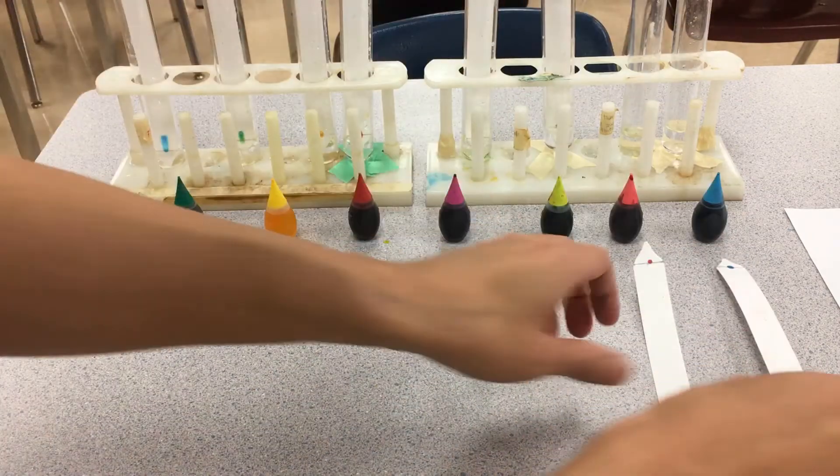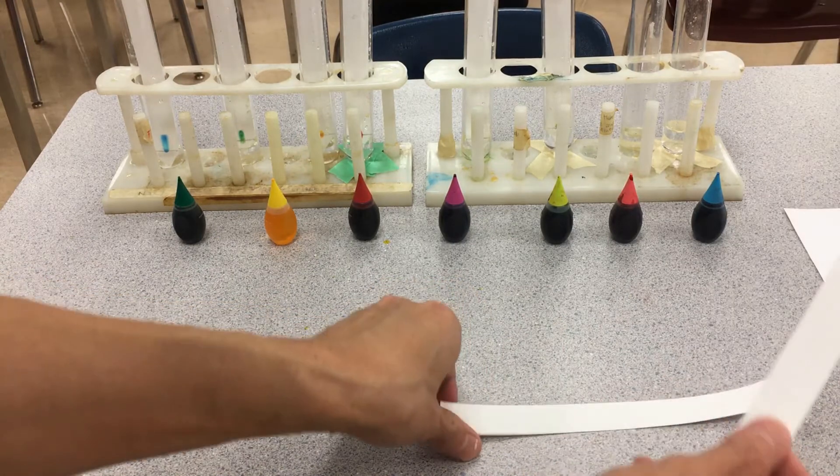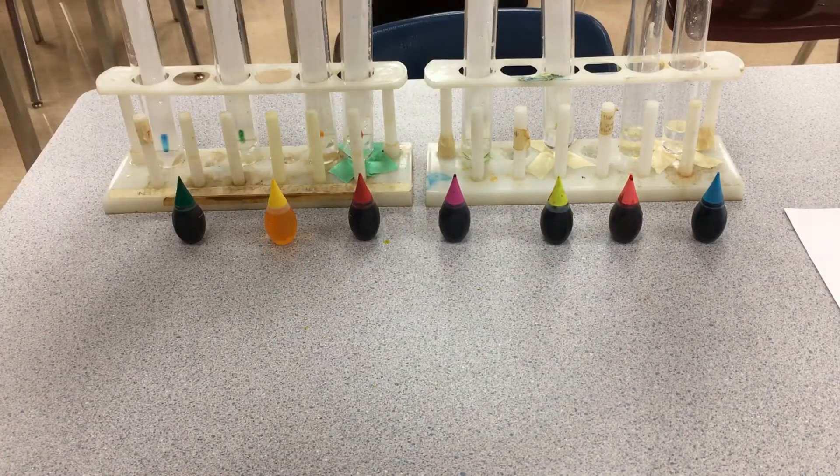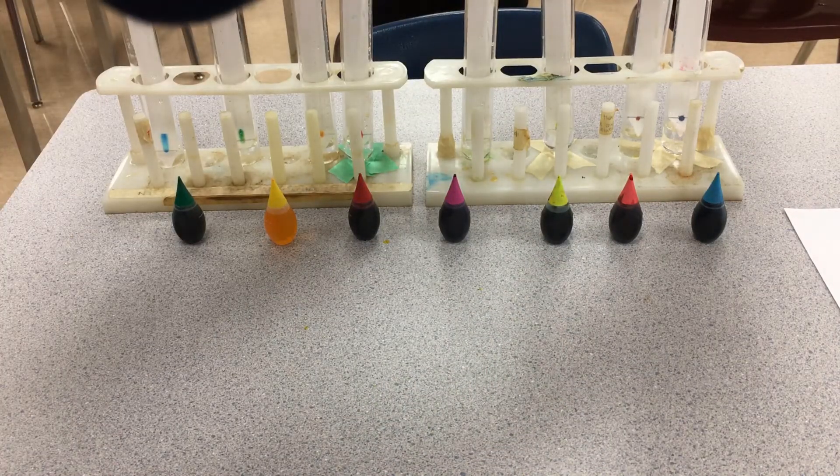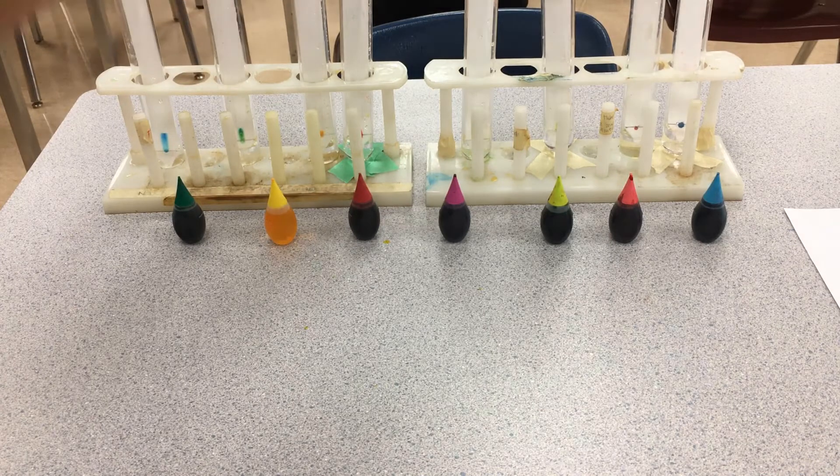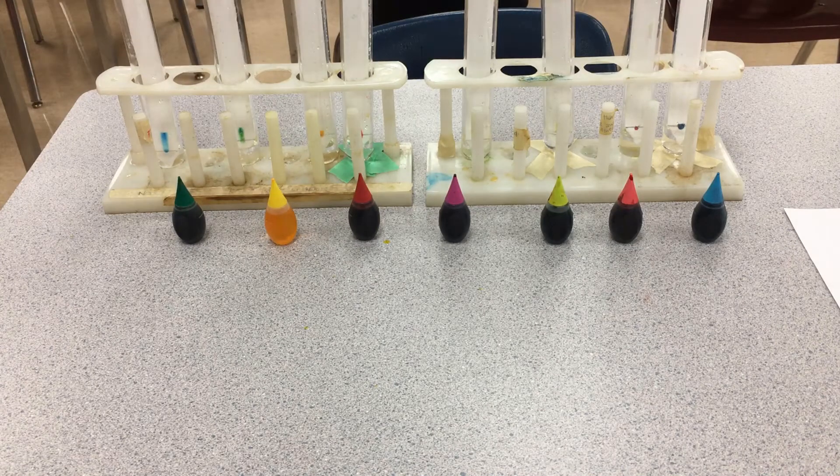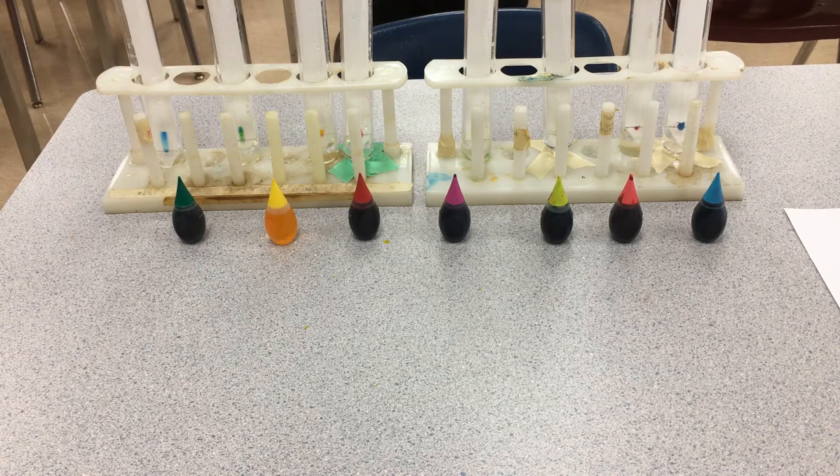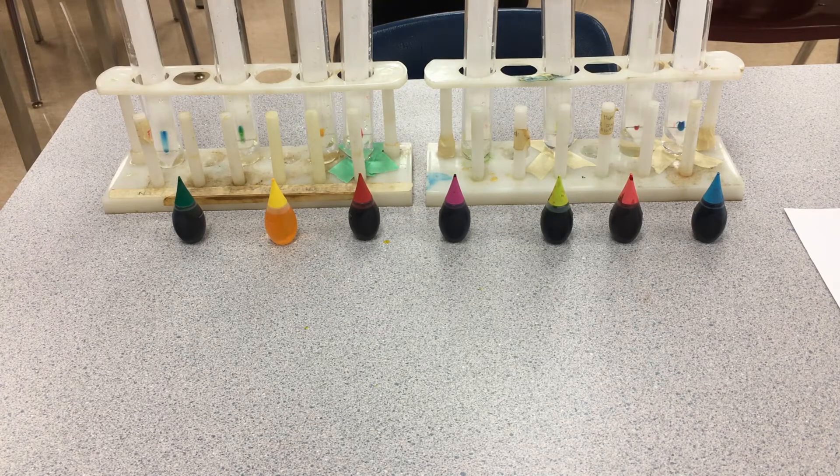If you dunk it in a little bit too far, the color just soaks into the test tube itself. We're going to leave this for about maybe five to ten minutes or so, and we're going to take a look at what's happened.